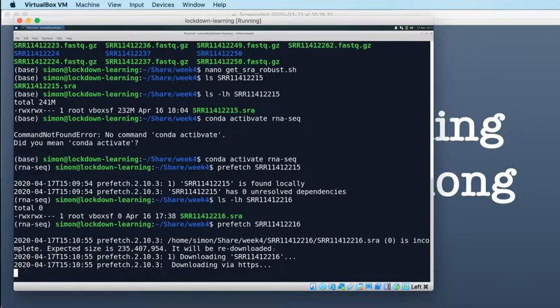Hopefully what we'll get back at the end of that is a success message. So what we really want is some way of checking whether Prefetch successfully completes or not. But actually, we can run this script and then we can run it a second time. And if we run it a second time, they should all just say that they've successfully completed. And hopefully then we've got all of the data. And then what we can do is go back and remove the SRA files once we've converted them to FastQ.